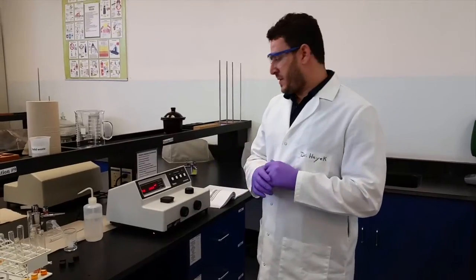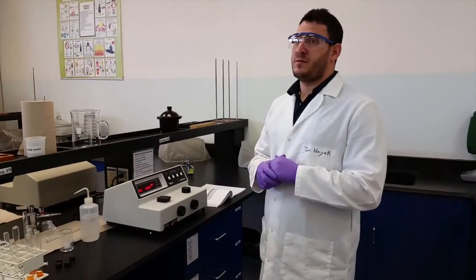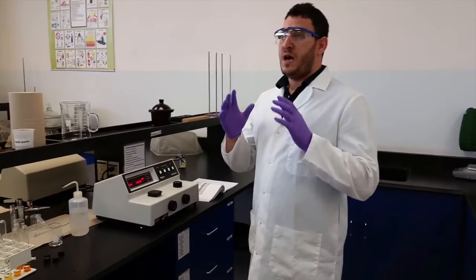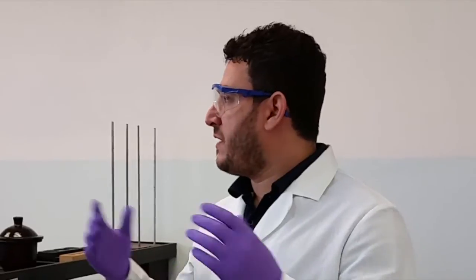In conclusion, the reason we are doing this experiment is that this teaches you how you can determine the equilibrium constant of any system at equilibrium in the lab.